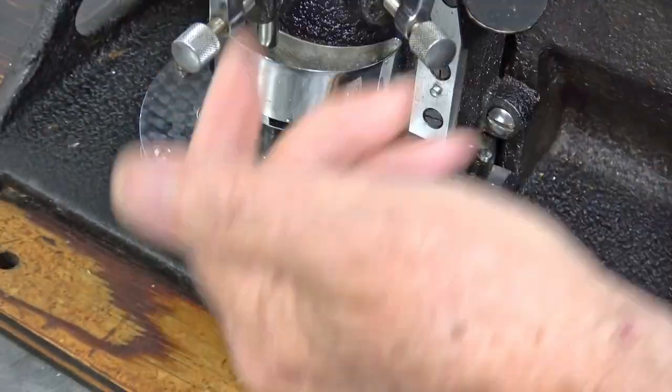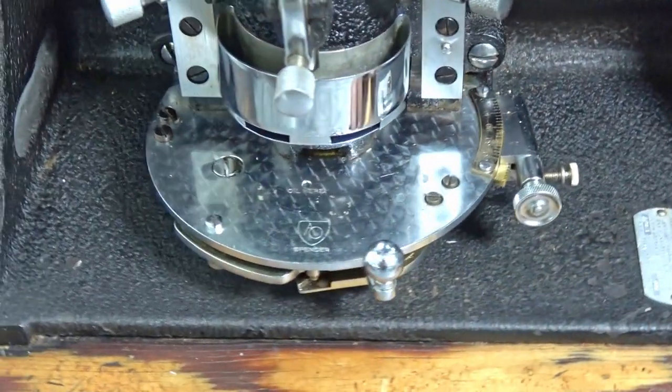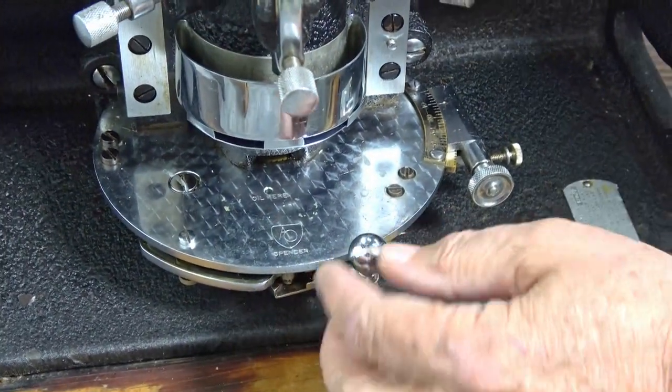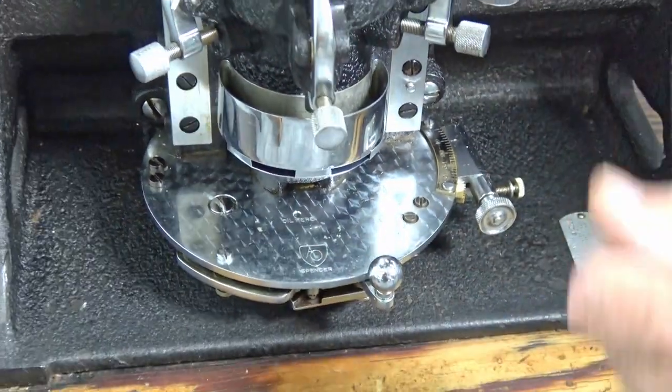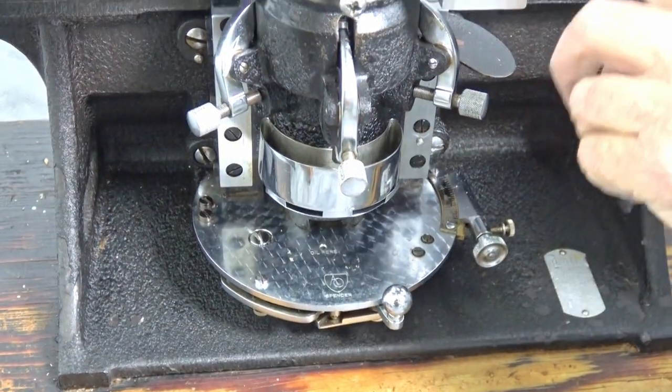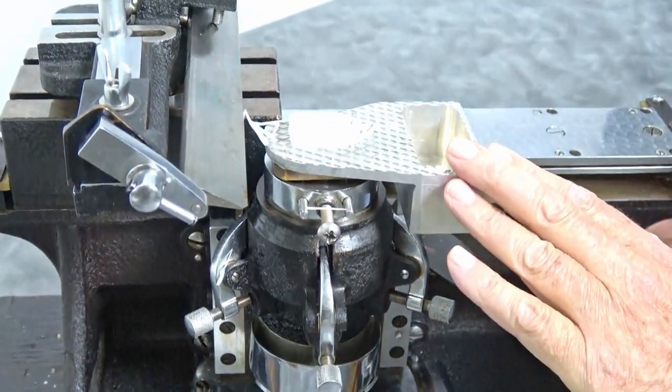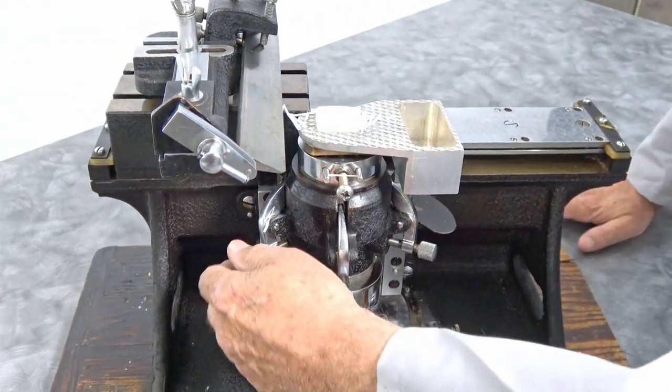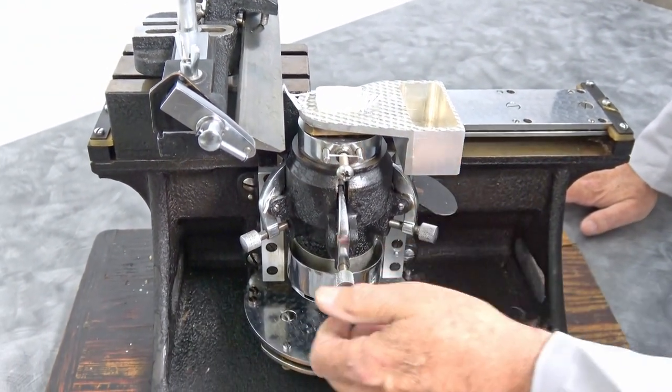There's your manual raise lever there, so when you pull it, it's actually raised that knife up. You can also change the attack of the knife. Samples don't attack, knives attack.